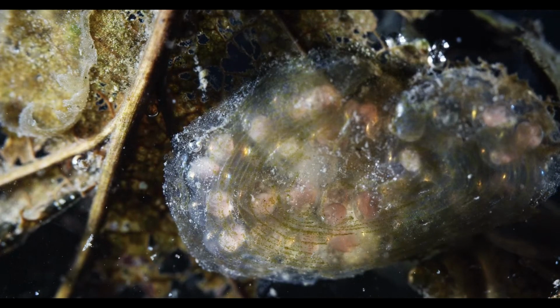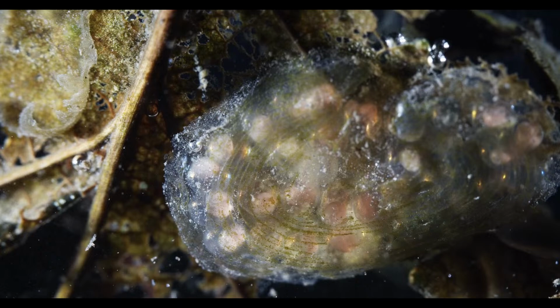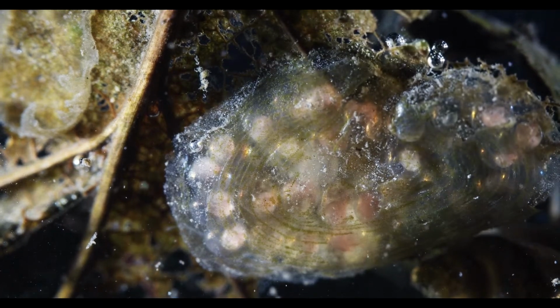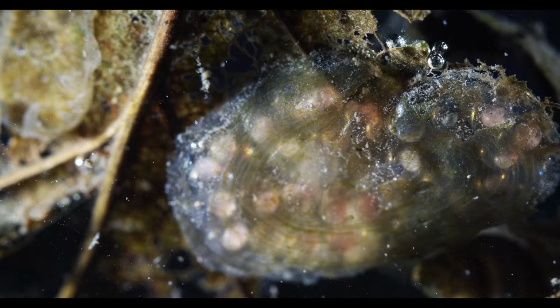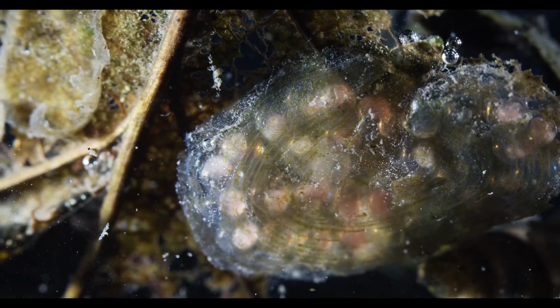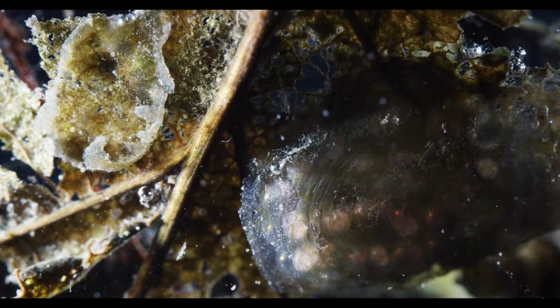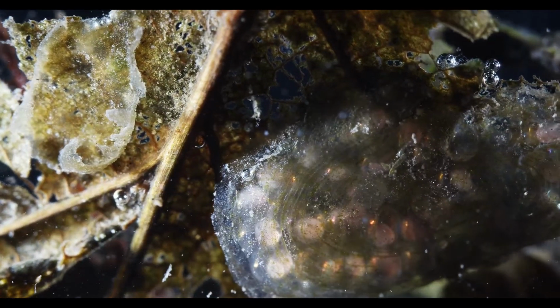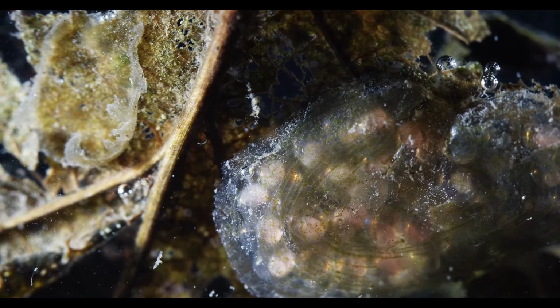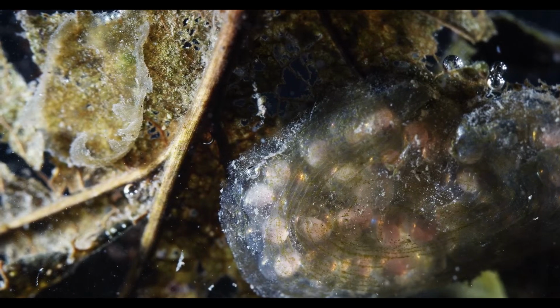Just assuming it's snails because it's kind of a gelatinous mass, and that's what snail eggs look like a lot of the time. And oh, there's a worm, a small annelid. Don't see him anymore, right? See him on the left edge of this egg cluster. There's something moving along, inchworming along.